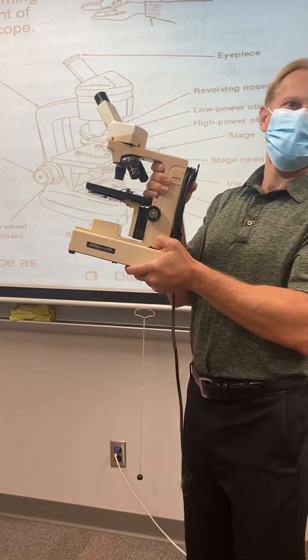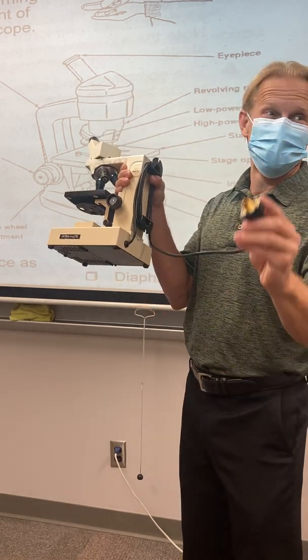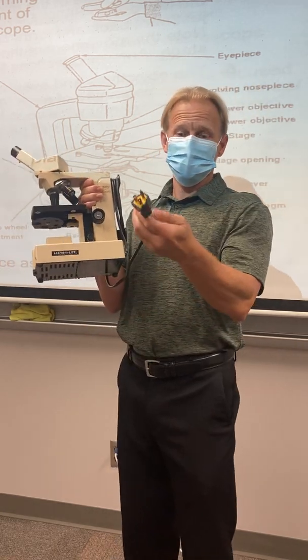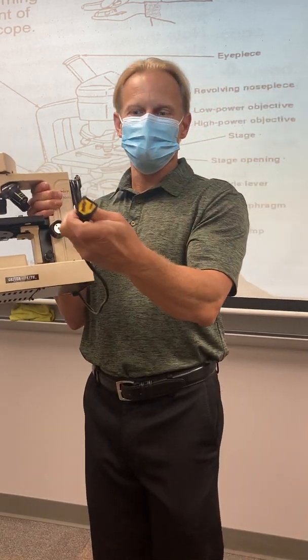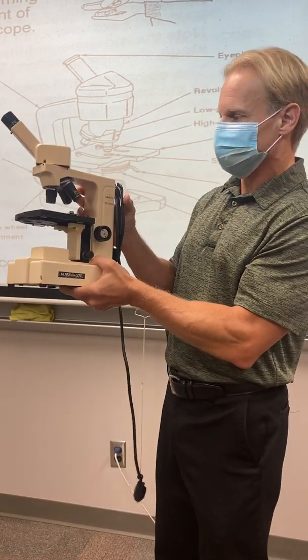If you flip it and nothing happens, the bulb might be burned out. So try the other direction. Check it's plugged in. Along with the plugs, don't yank these out of the wall, because sometimes you yank the plug off and then we have sparks, and we don't want that. That's not too good. So if we're taking them out for the day, just unplug them. I think we're going to leave them out today because every other class is going to use them as well.